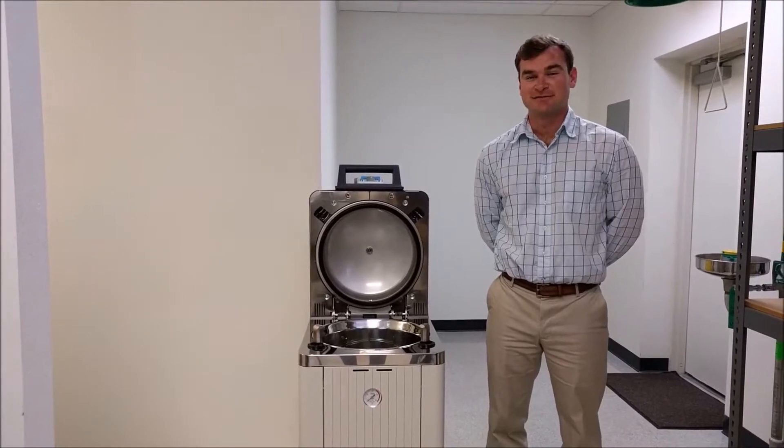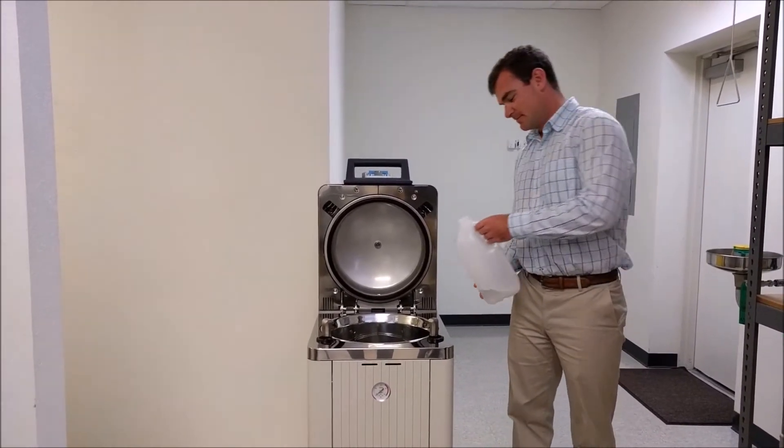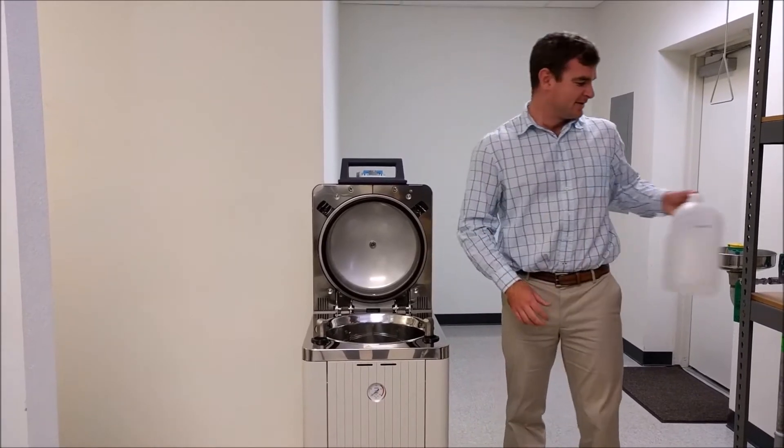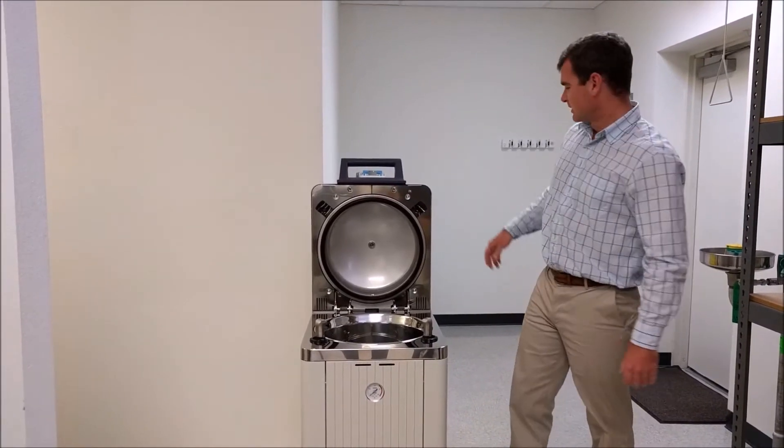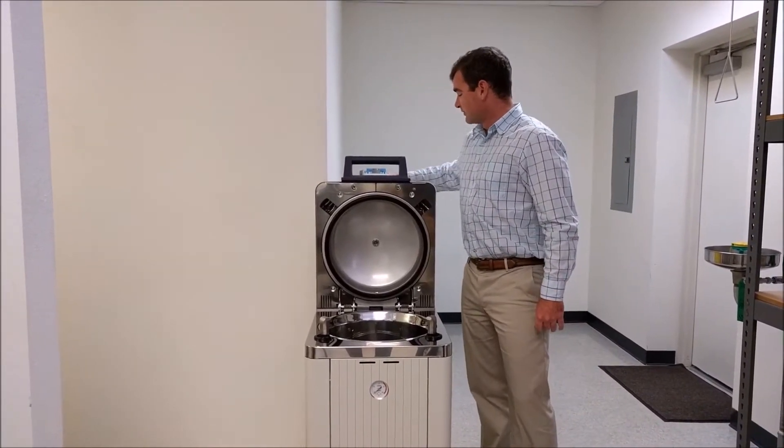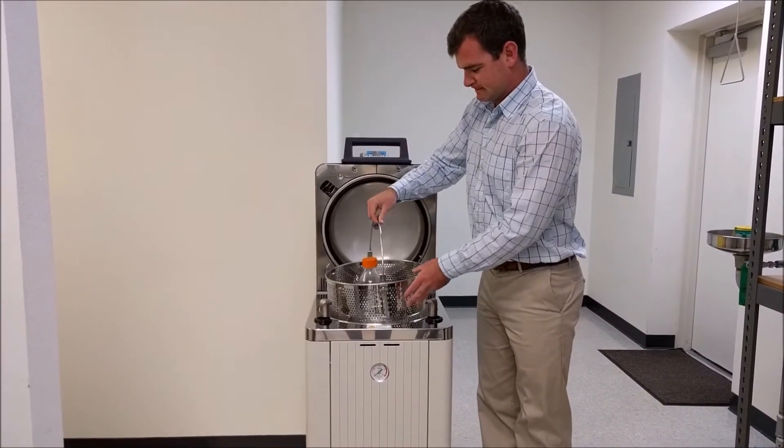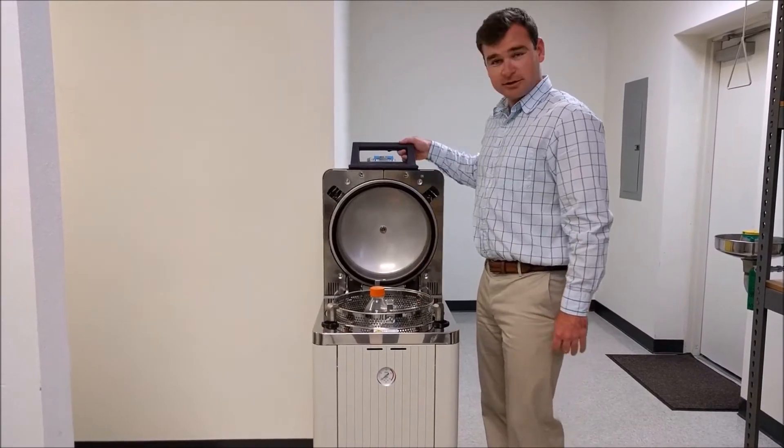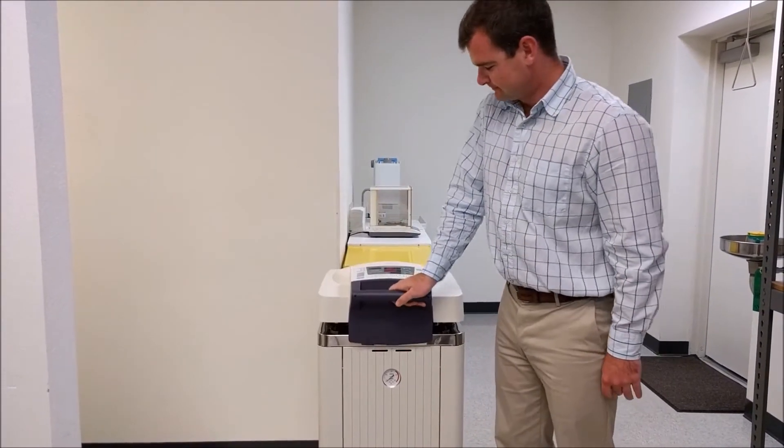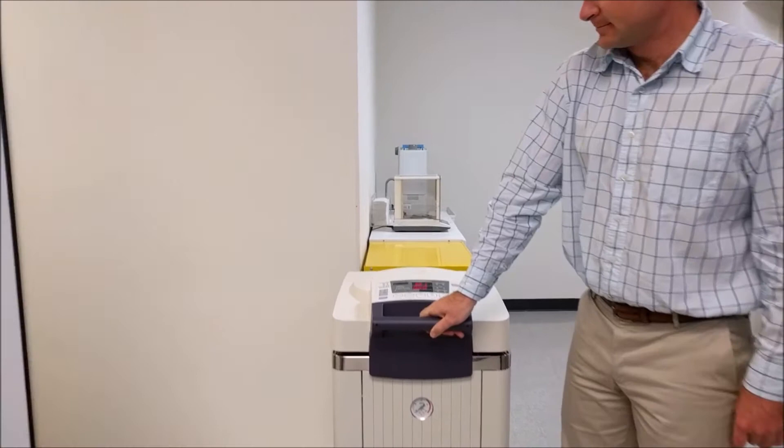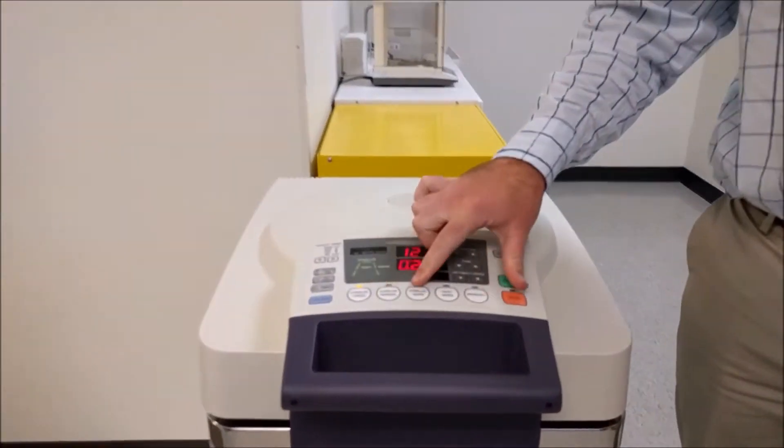The operation is very simple. You simply add water to the system, place your sample in the basket inside of the chamber, close the lid, and simply set your sterilizing mode here.